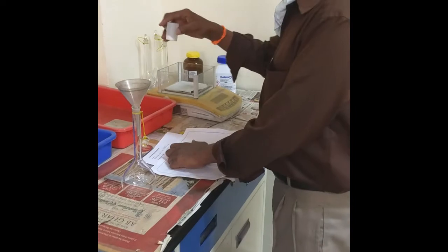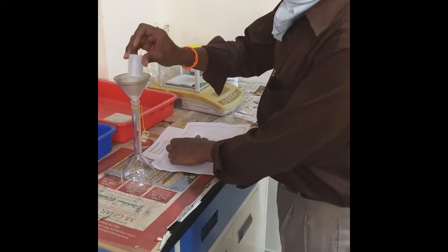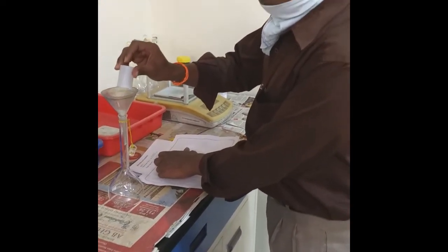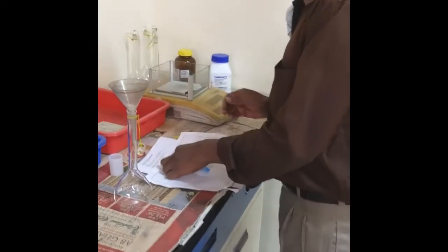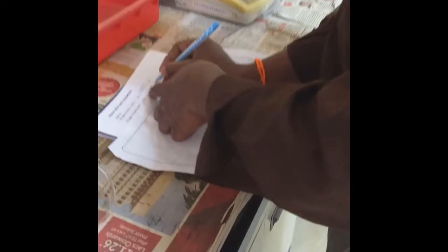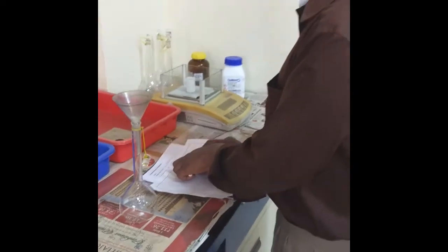Now I will be transferring this to a funnel with a volumetric flask which is previously rinsed with distilled water. Then I will be taking the weight of the weighing bottle alone, that is W2, which is coming to 3.5 grams. So we need to take the difference of these two.